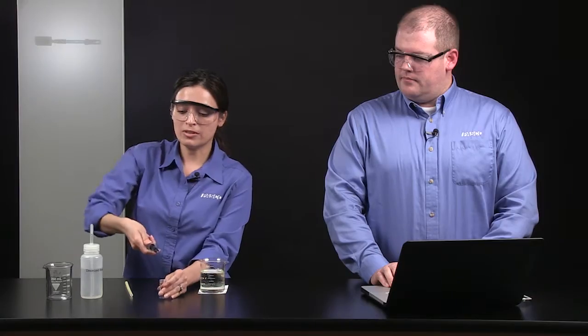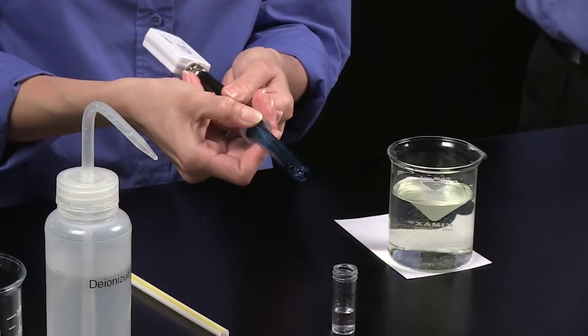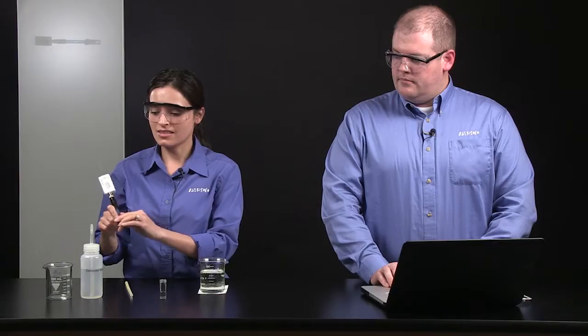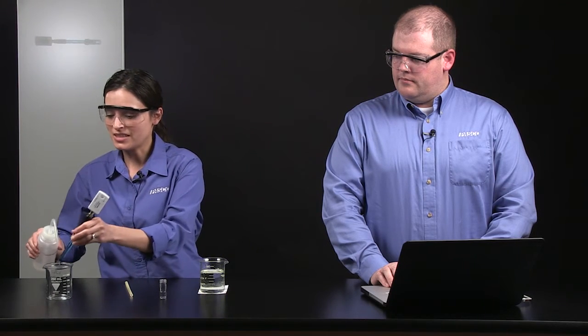It's a good idea to remind students to push the cap up when you remove the probe from the solution so that it does not get into the test substance, and then to rinse the probe with deionized water.